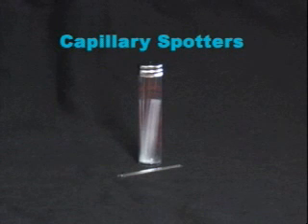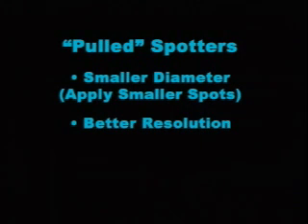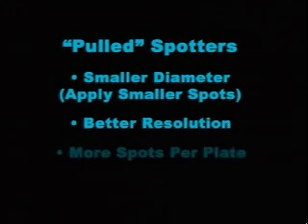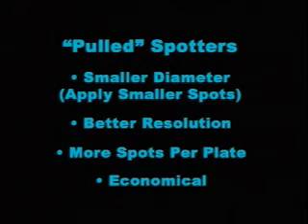With your plates ready to go, now it's time to pull some TLC spotters. While commercially available capillary spotters can be used to apply samples to TLC plates, many people prefer to pull their own spotters. This is because pulled spotters have a smaller diameter, so you can apply smaller spots to the plate. This means that you get better resolution, and you're able to spot more spots per plate. Because you can conserve plates, this makes pulling your own spotters the economical choice.